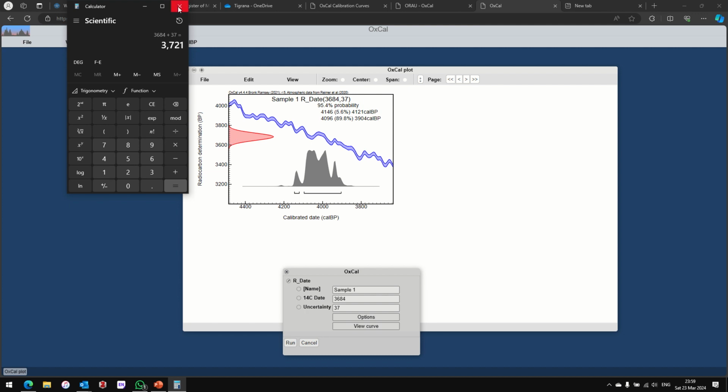the curve is anything to go by, because I'm looking at something between 3647 to 3721, and that certainly does not seem to be the case here. It's going well into the 3500s, this little red bit.